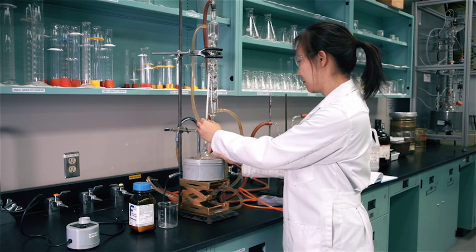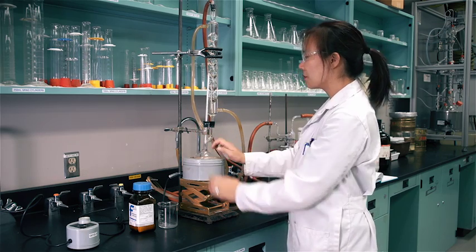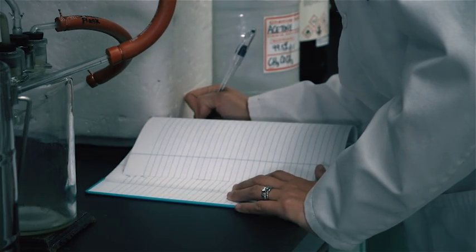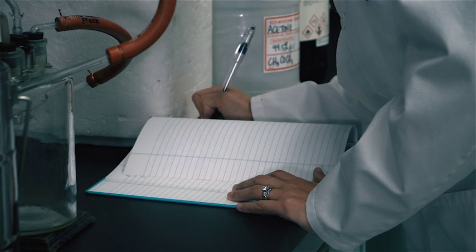Repeat the procedure until the manometer reading is close to zero and the pressure in the system is close to atmospheric pressure. Make sure you have a minimum of seven to eight boiling points recorded.